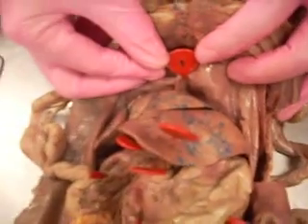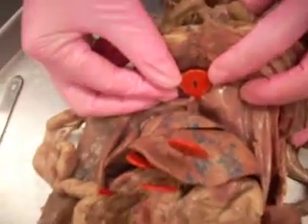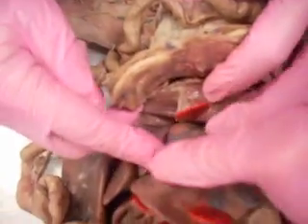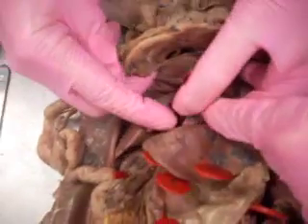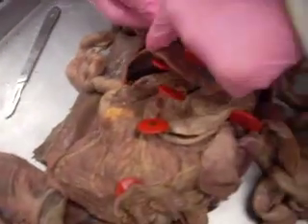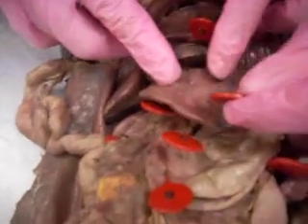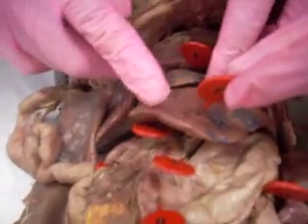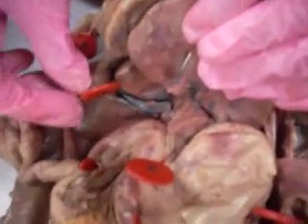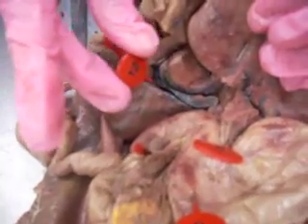Number one is the falciform ligament, going from the bottom of the diaphragm through the lobes of the liver. This is the liver here, number 11 — going out of order. And then at the base of the liver, you can see number 12 is the gallbladder.